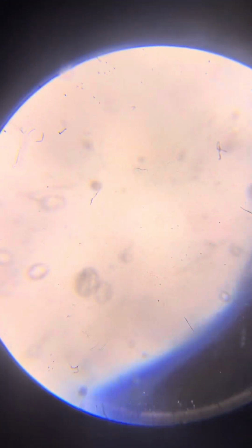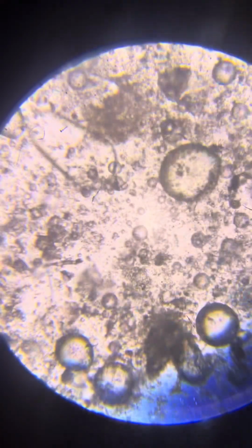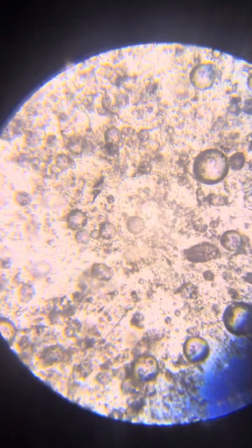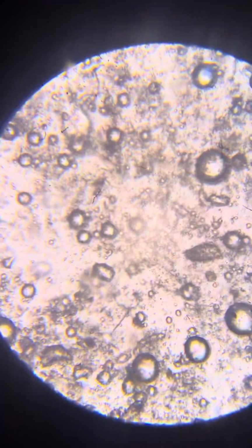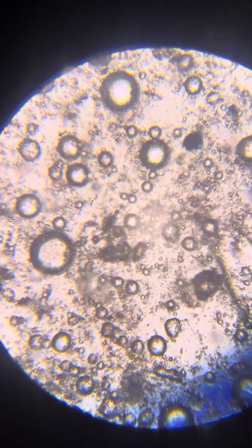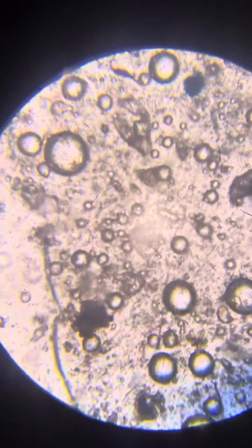Very nice. Maybe zoom in some. Nice. I'll touch it just so you see some flow.